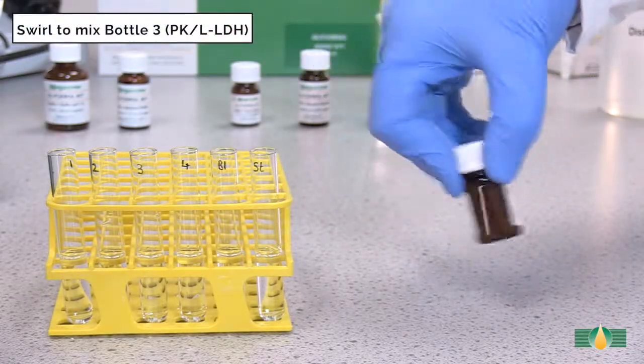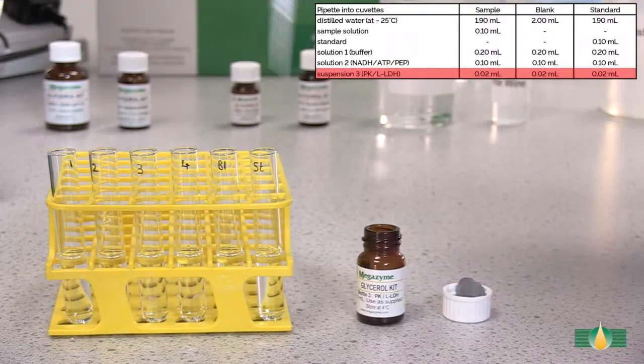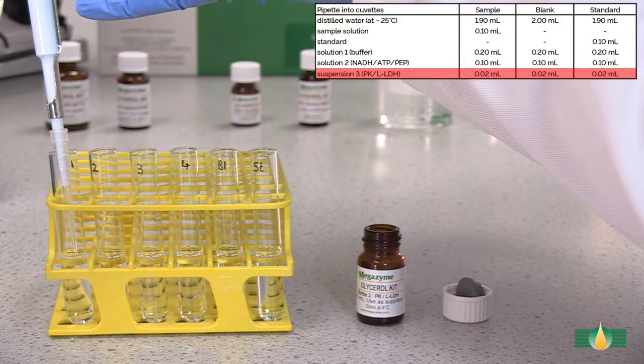Swirl to mix the contents of bottle 3 prior to dispensing. Pipette 20 microlitres of suspension 3 into all assay tubes.